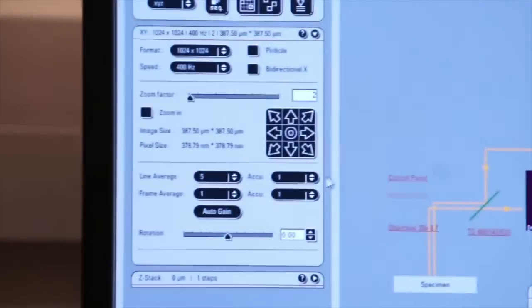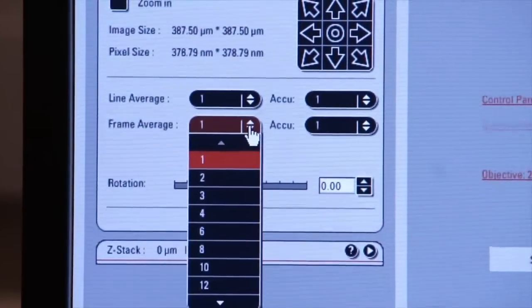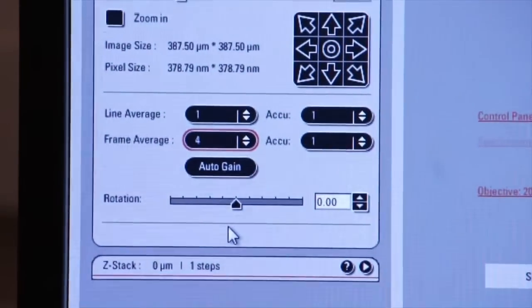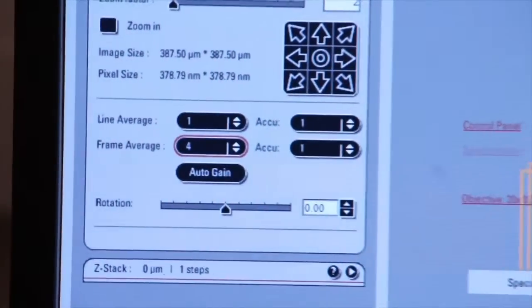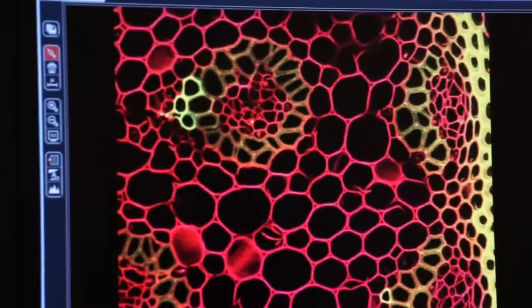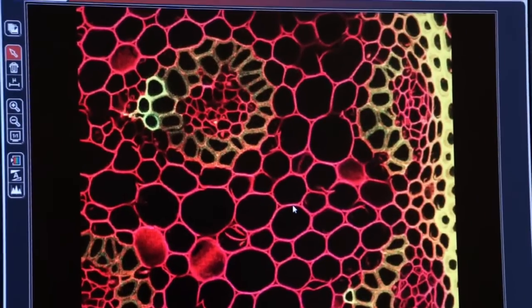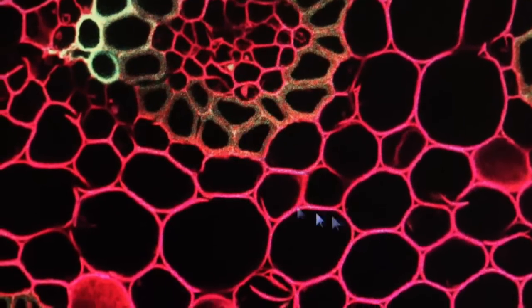So we'll go back over here, we'll turn line averaging back to 1, and we'll take frame averaging, let's make it 4 frames. So now we're going to average each of 4 frames together, and let's see what our image looks like. I'll click on Capture Image, watch the screen here, and you'll see our high resolution image come up a little bit faster and a little bit grainier. So you can see that frame average is not as good as line averaging for producing a nice clean image.